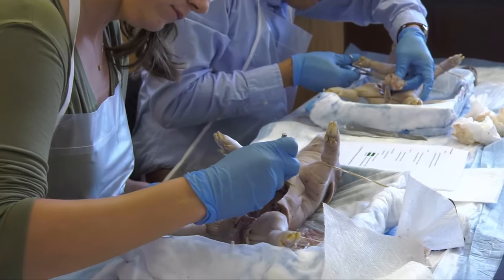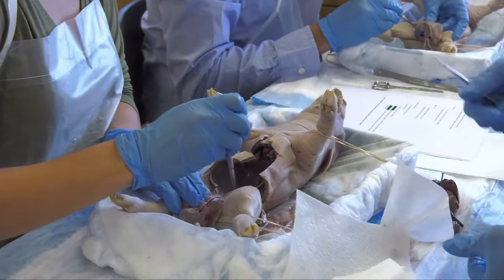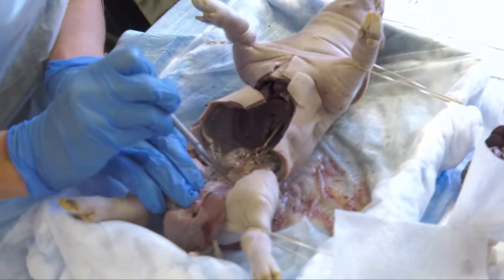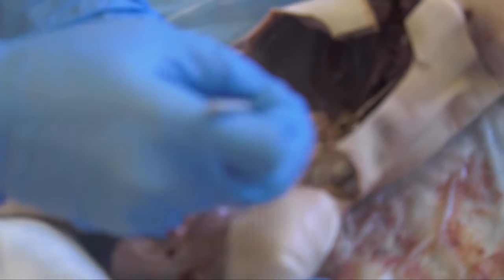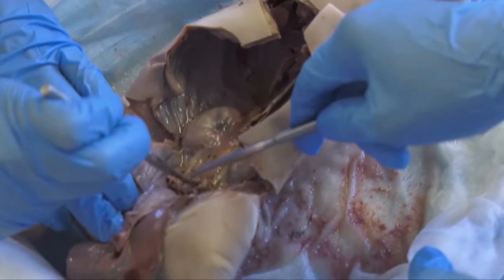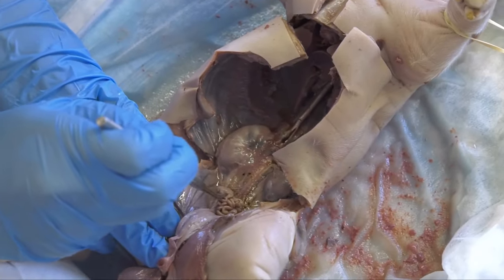Sarah has a female pig. Sarah, what are you identifying? The oviducts. So Sarah is showing us the oviducts. Sarah, will you also show us the ovaries? Little bean-like structures — she calls them little bean-like structures. We have this uterine horn, and these little bean-like structures at the tip of them are actually the ovaries of our female.